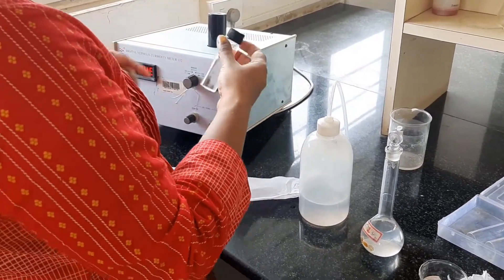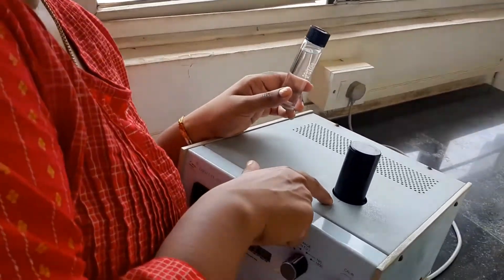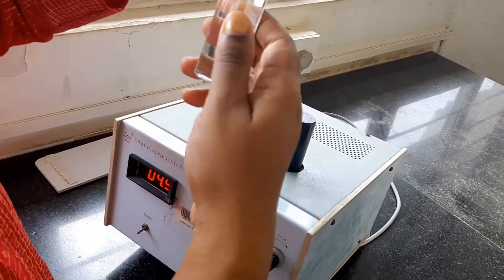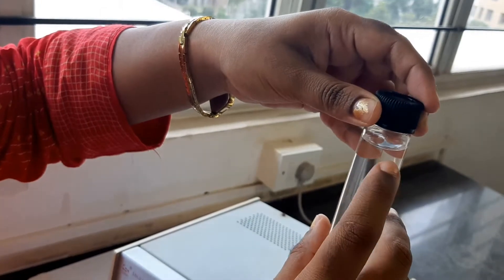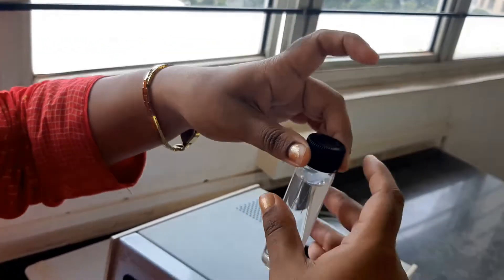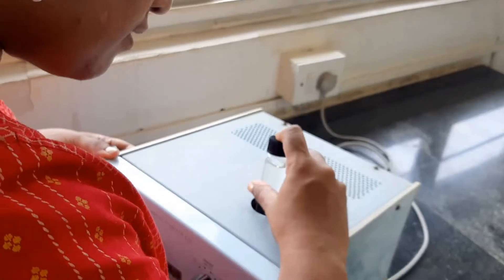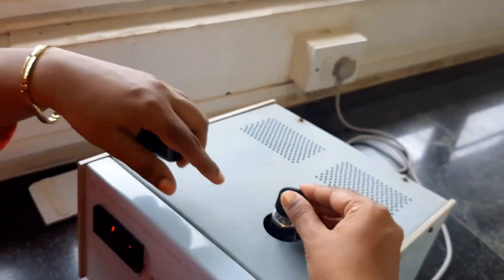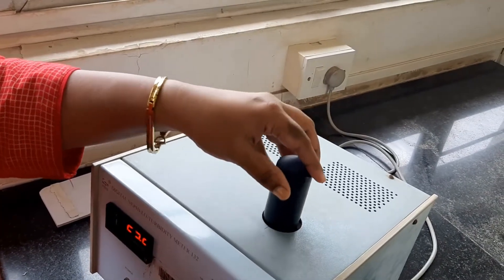Now you can see there is a black mark on the instrument and there is a black mark on this tube also — those should coincide. So I will align it here, making sure these marks coincide, and then close it.